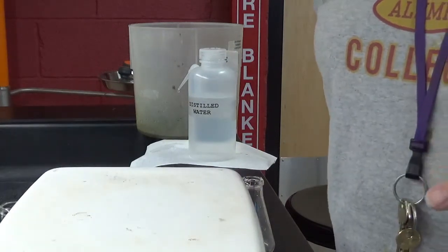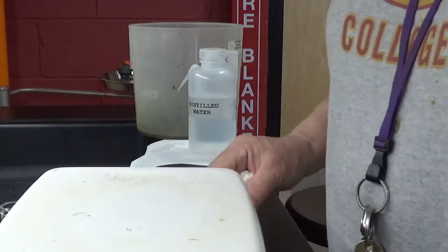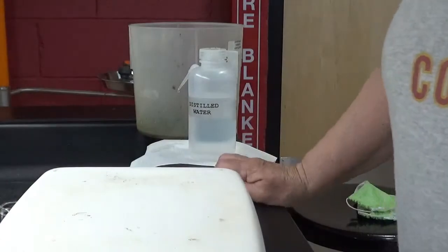Now we're going to go on to experiment number 2, and then we're going to end with 8. But we're going to ask you to do your own timing each time.